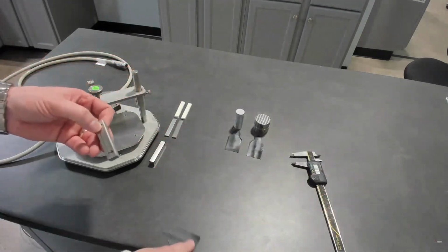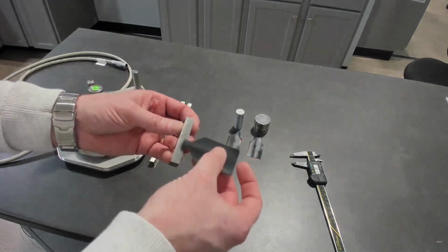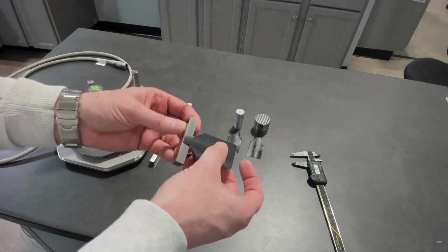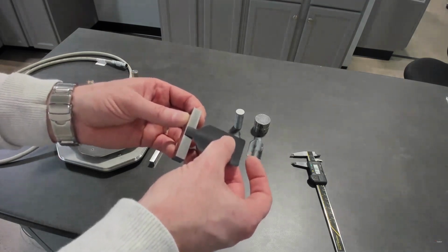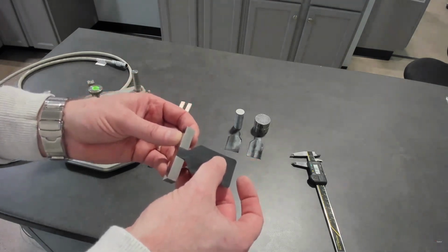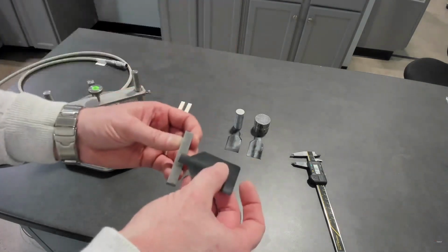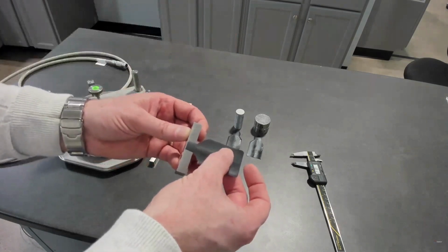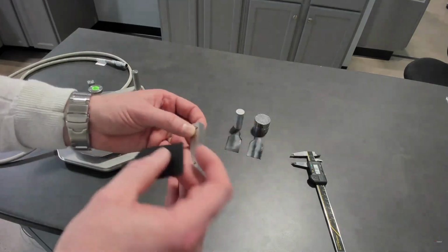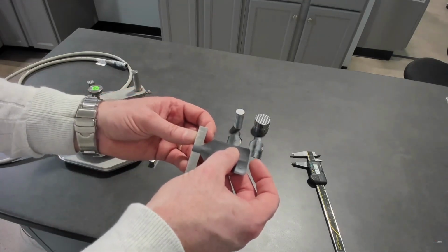Whichever is the smallest dimension of those three, either side or the thickness, is the penetration depth you have. Looking at this as a bulk sample or semi-infinite body, we want to stay within the dimensions of the sample. But if your sample is this shape, that's a very specific advantage, because now we can look at two dimensions, which gives us more flexibility in testing a unique shape.